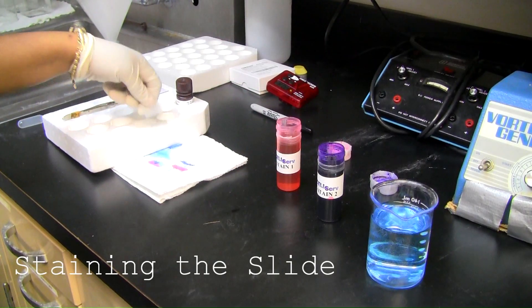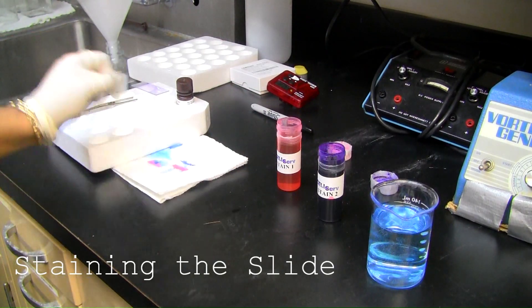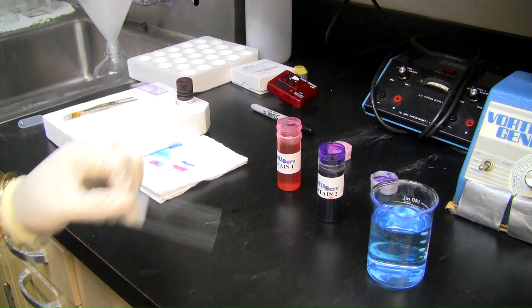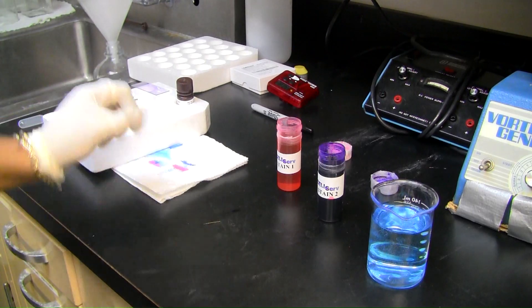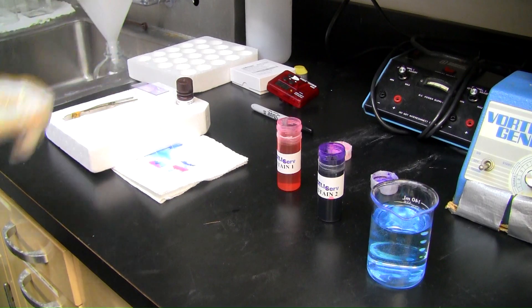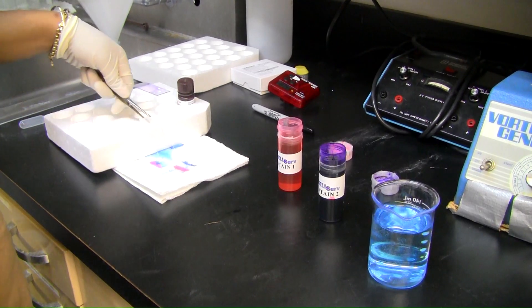After splatting the cells on the slide, wave the slide back and forth at a 45 degree angle. This will dry the slide and increase the number of chromosome spreads shown on the slide.